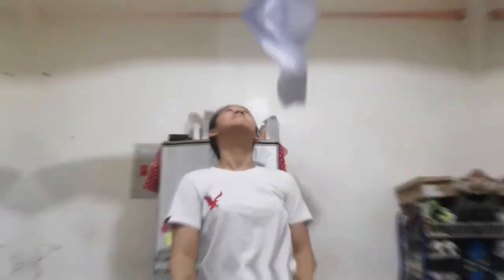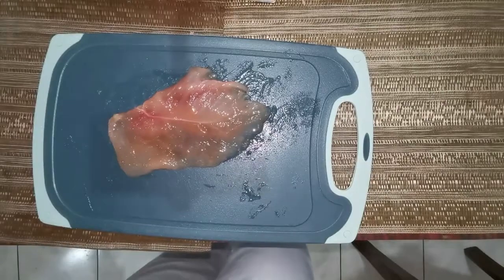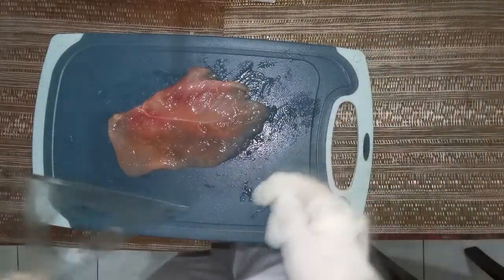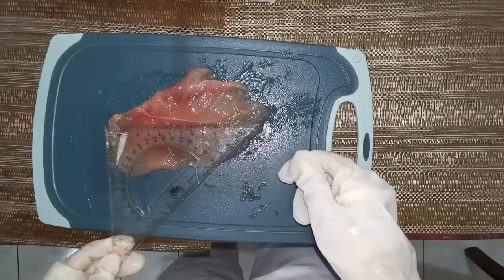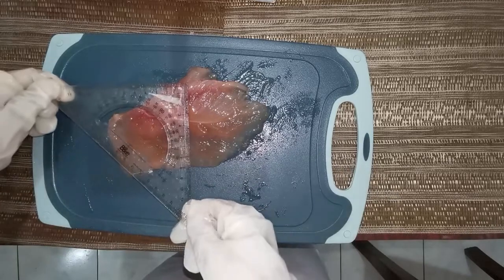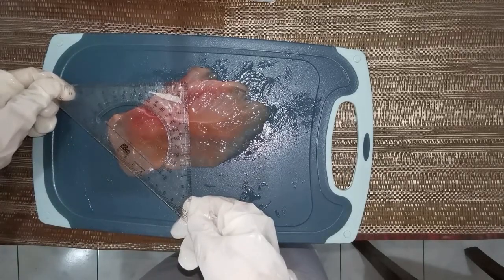I am Rouella Maglana and I will be performing the proper fixation of tissue samples. Let's go! So here's our sample at approximately 50 grams, a pinkish color and a smooth texture. That is 11 by 7 centimeters with a slightly slimy consistency.